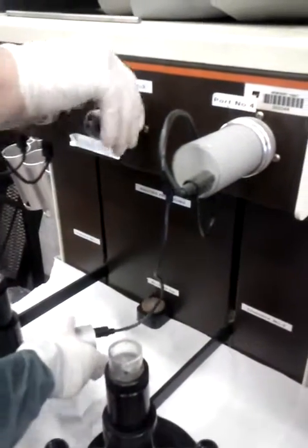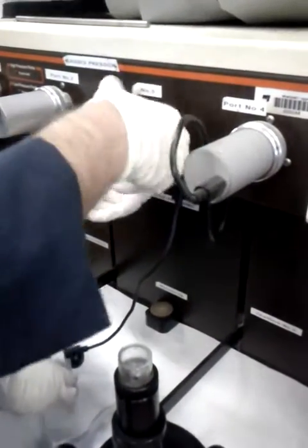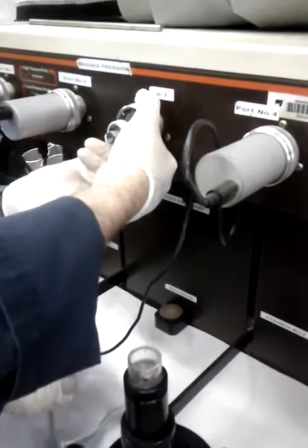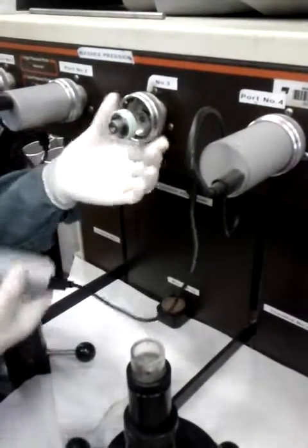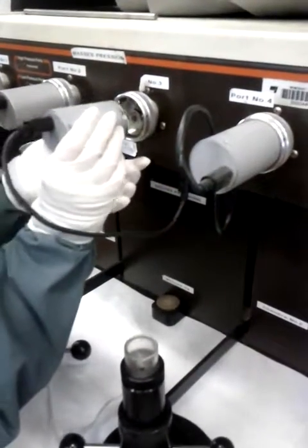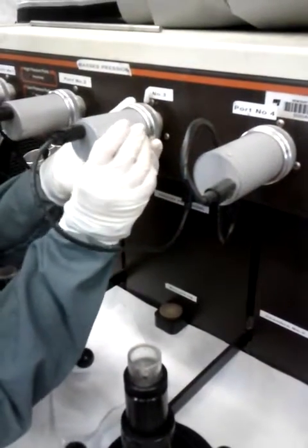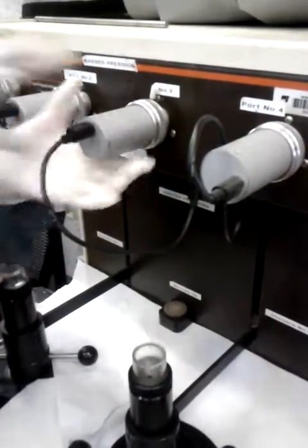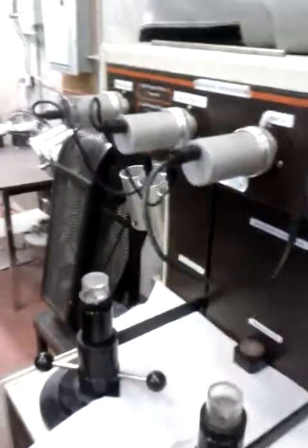You have to screw it. And now you can put on the... okay.